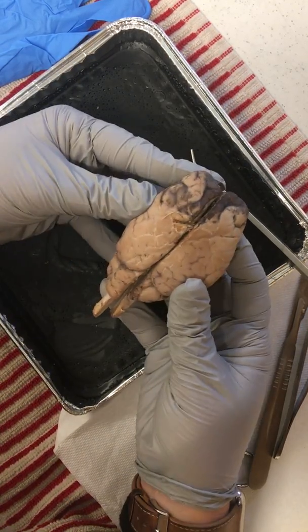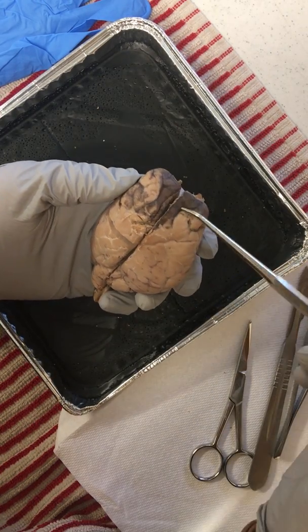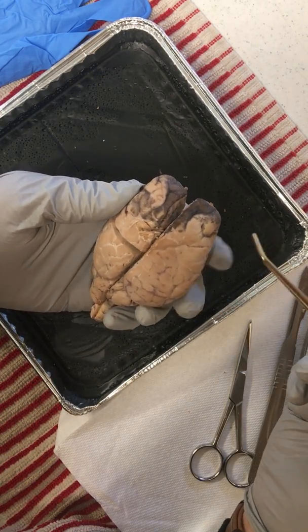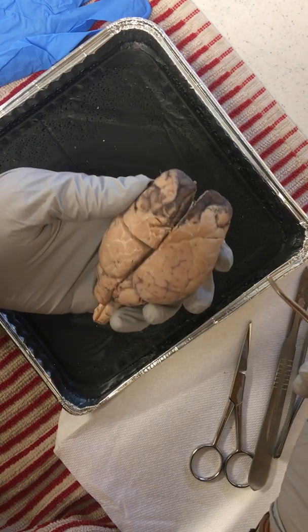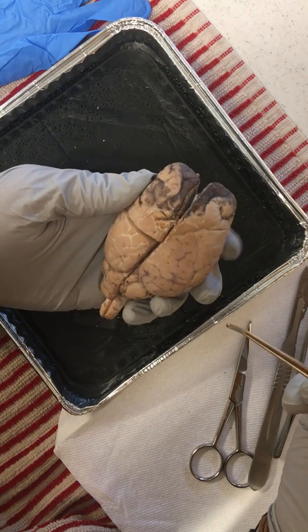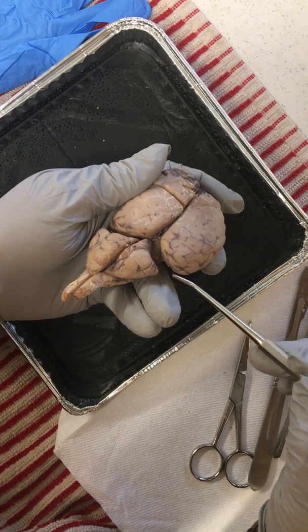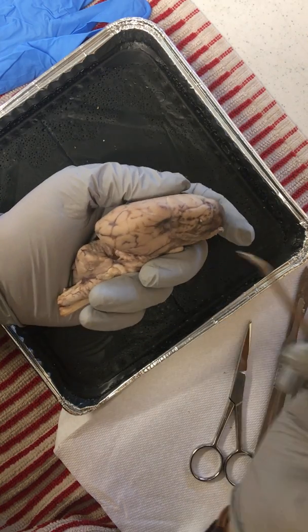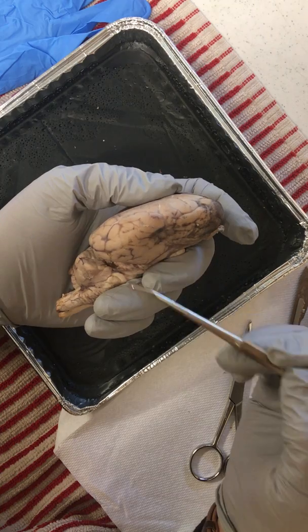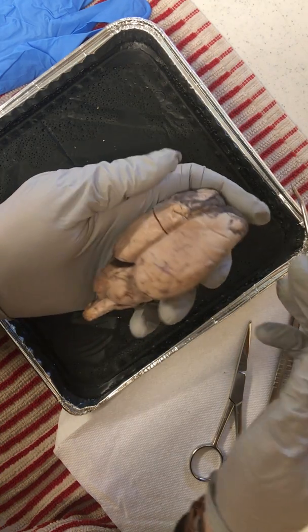As we look here at the dorsal view, we're going to go through the different lobes pretty quickly. We have our frontal lobe, which is responsible for motor function, our parietal lobes, which are responsible for receiving and processing sensory information, and occipital lobes here in the back end, responsible for receiving and processing information from our eyes. And inferior to the parietal lobes, we have our temporal lobes, which receive and process auditory sensations and information.